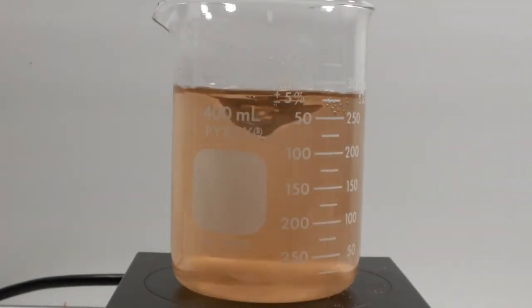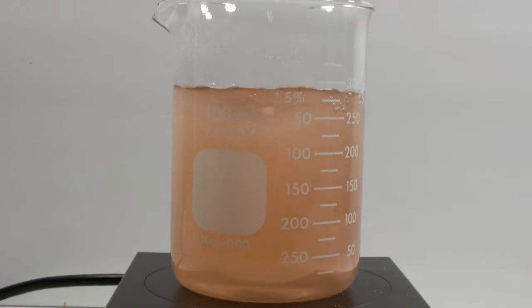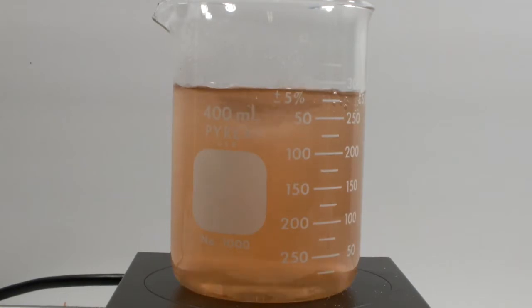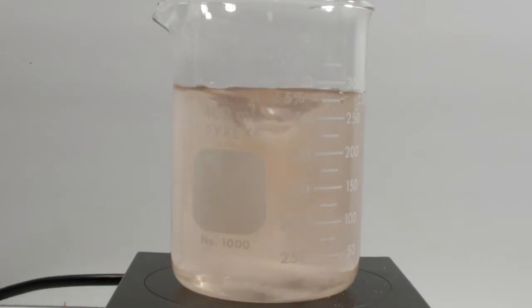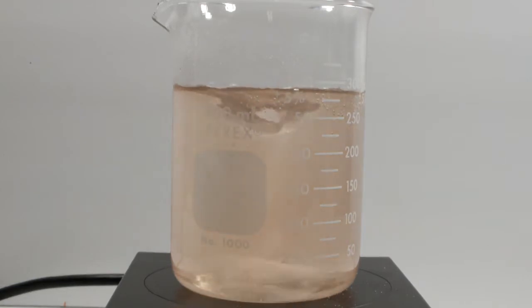Alright, so it turned orange. Now what? I'm leaving this in real time because the first color change takes about 20 seconds, and then the oscillation interval speeds up a bit after that. Okay, now we're talking. This reaction will go on for another 30 minutes or so, with the oscillations getting less and less frequent over time. Towards the end, we will start to see some more carbon dioxide bubbles forming.